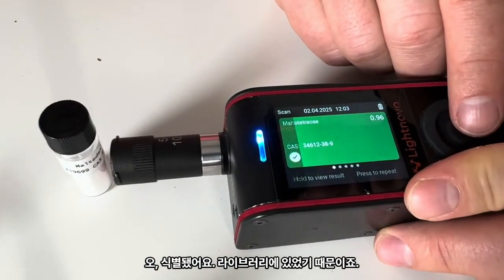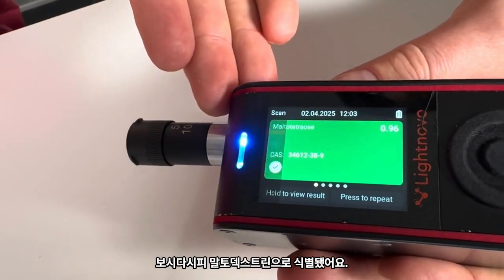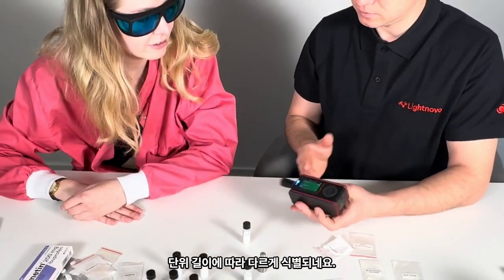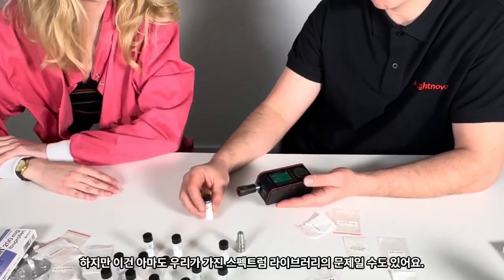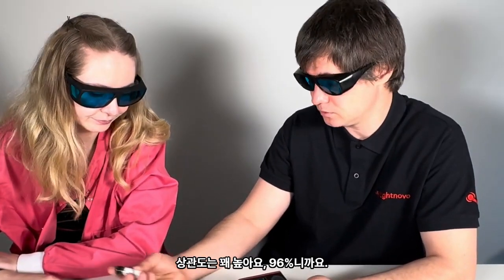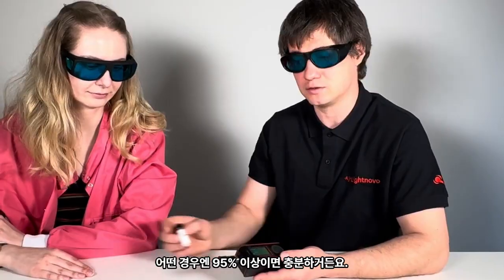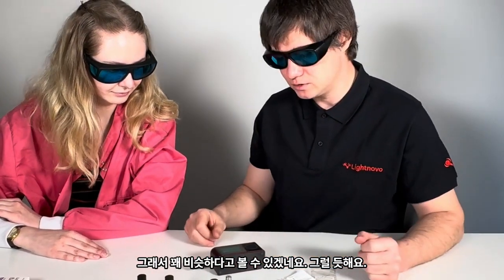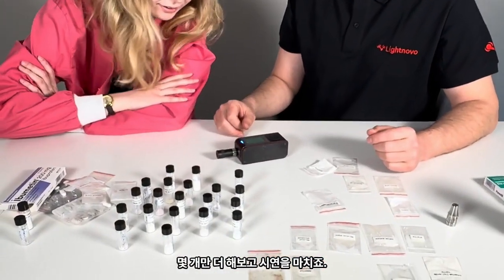Oh, and it identified it because it's in the library. It's the same, you see, it's tetraose. It just identifies different chemical length of units. Okay, but I guess it's also a matter of our spectral library. You know, the correlation is quite high, 96%. So actually, it passes according to pharmacopoeia. It should be for some cases more than 95%. So probably, yeah, they're quite similar.